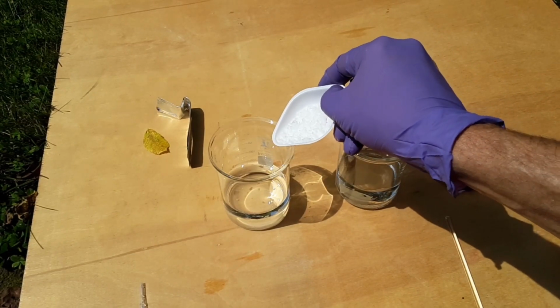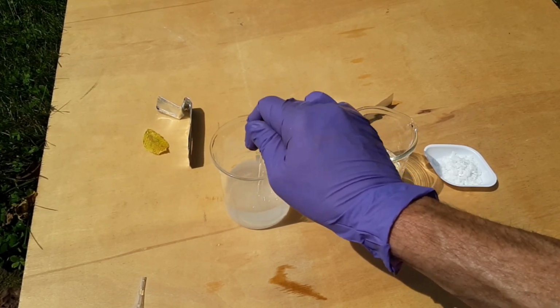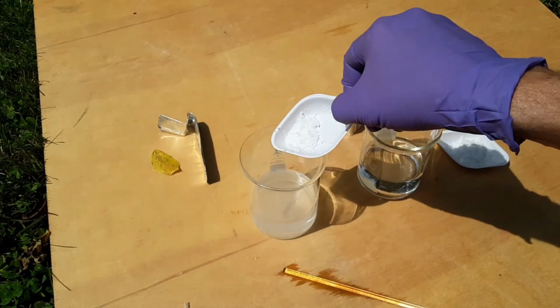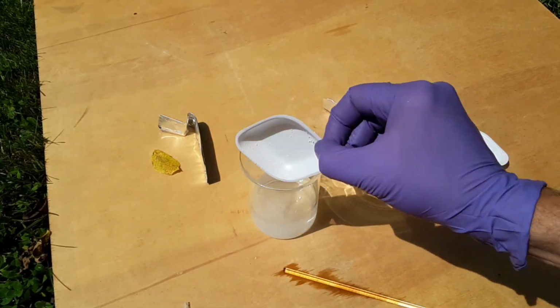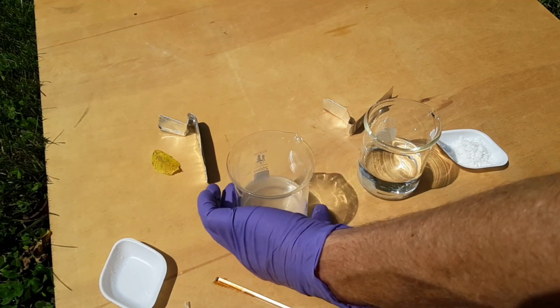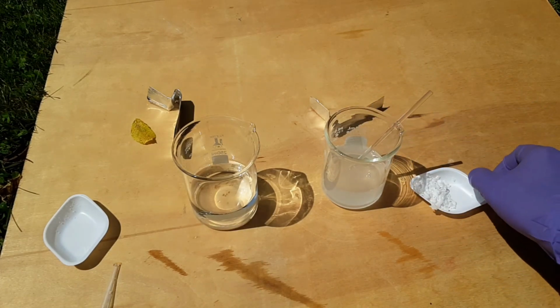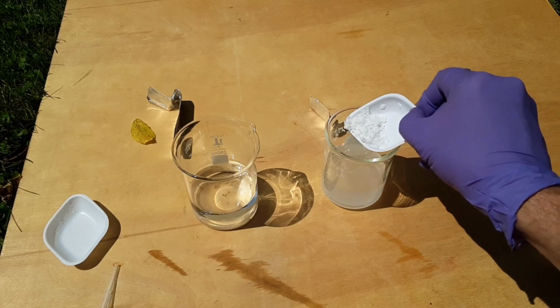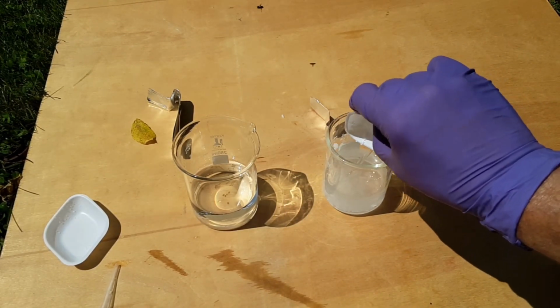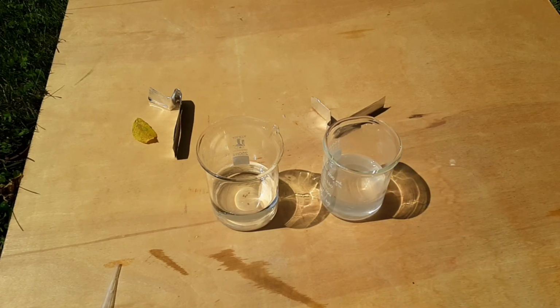And I cannot work with this camera in front of me. Just absolutely cannot. Sodium hydroxide is very soluble in water, so you don't have a problem getting it to go into the solution. It's pretty warm. These flakes, they're like crazy sticky. They suck water so bad. It's not super hot.